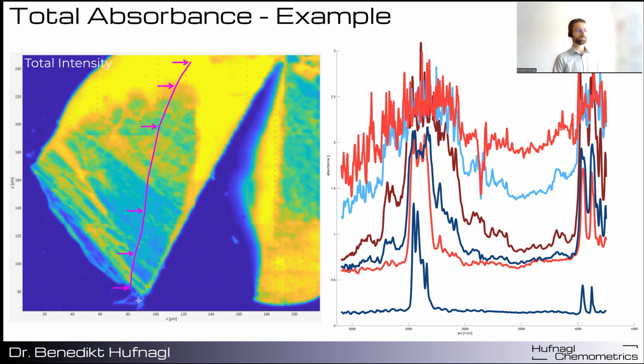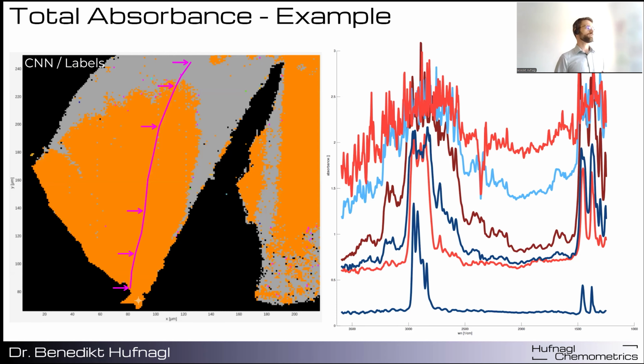Yes, if you train the models well. So here you can see a result from a convolutional neural network, and you can see up to this spectrum. So this is the one in blue. The model is still able to recognize this as polypropylene. Then the color turns gray, because this reflects the class other, which is unknown.